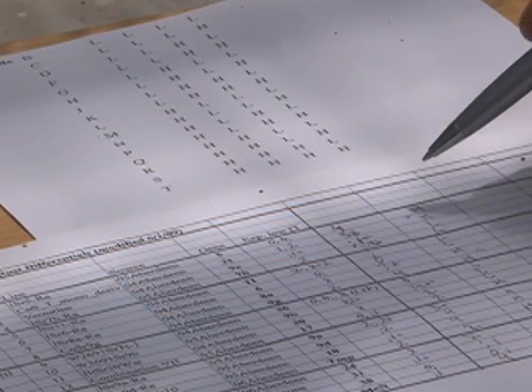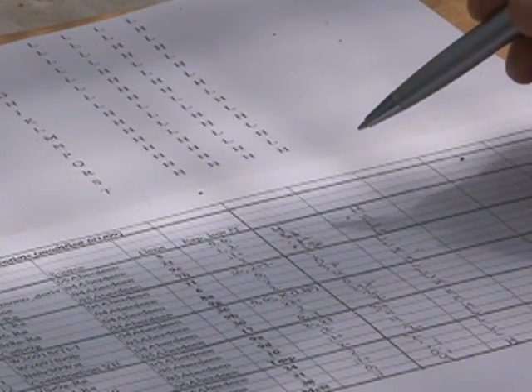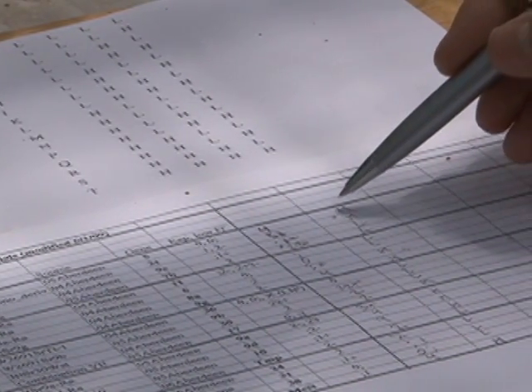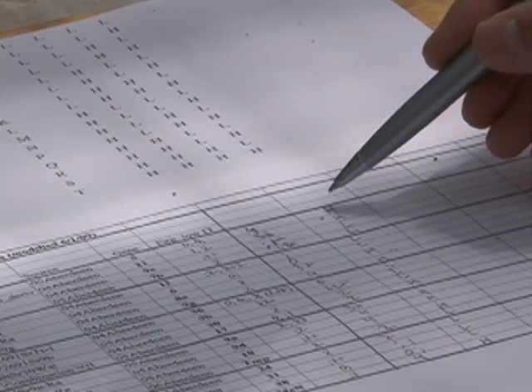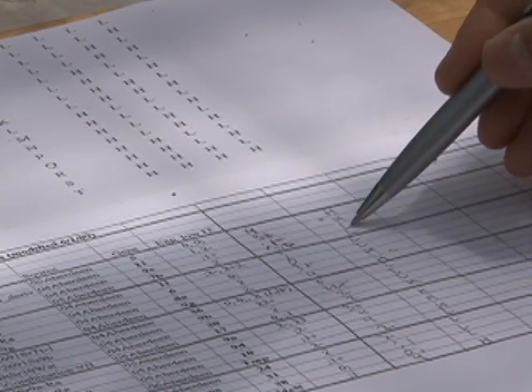Once you have determined whether each infection type is high or low for the 20 differential lines, you can assign a letter code for the high and low pattern. These 20 differentials are divided into 5 groups of 4. The first group of 4 has the infection type pattern: high, high, low, low.